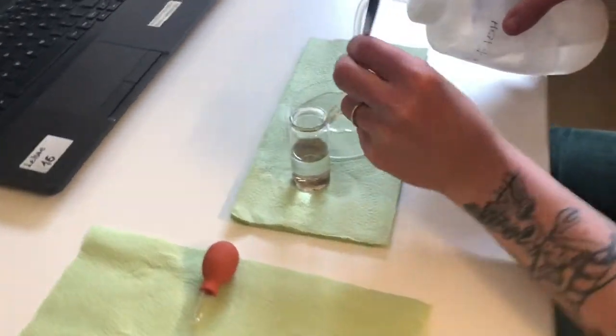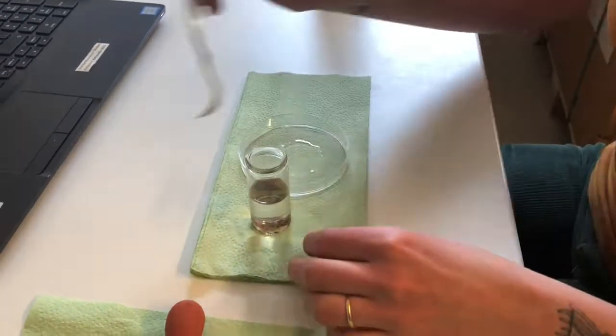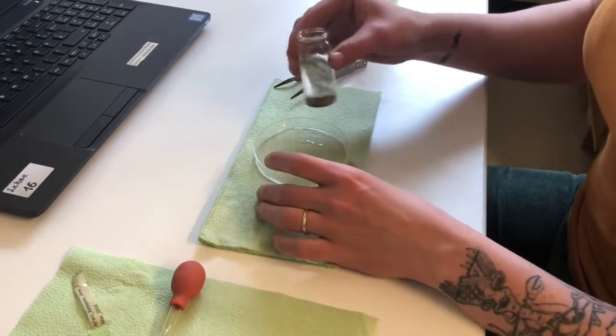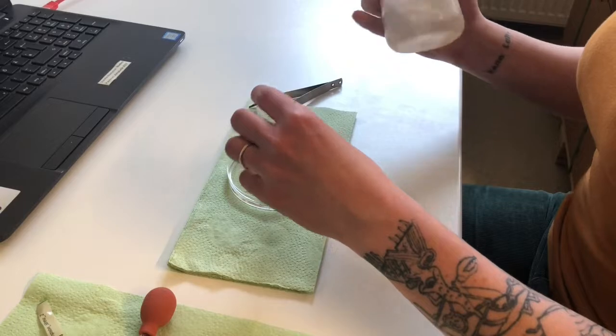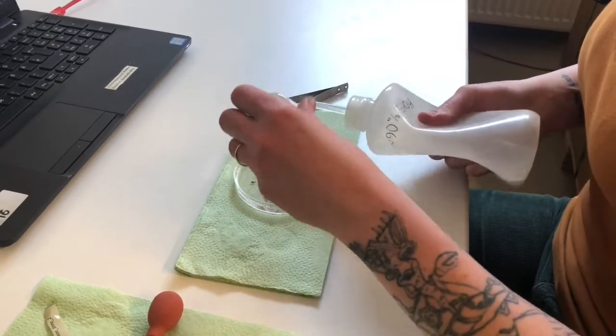We flush animals stuck to the label. We shake the vial to detach animals from the bottom of the vial and transfer them into the petri dish. We flush the vial to transfer all animals.